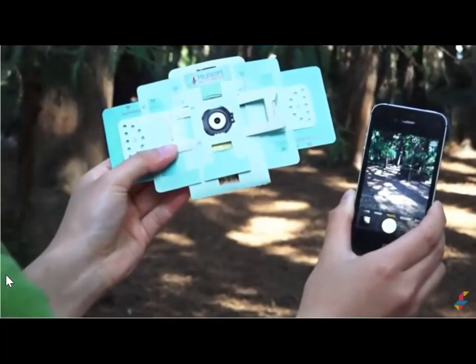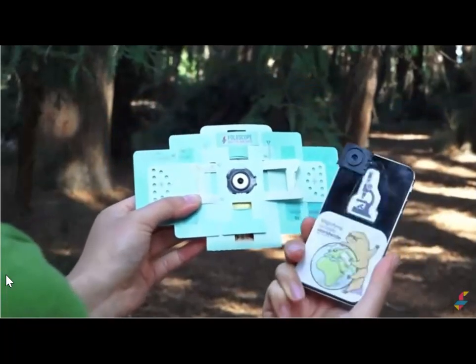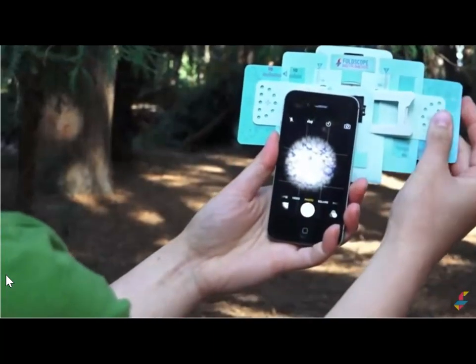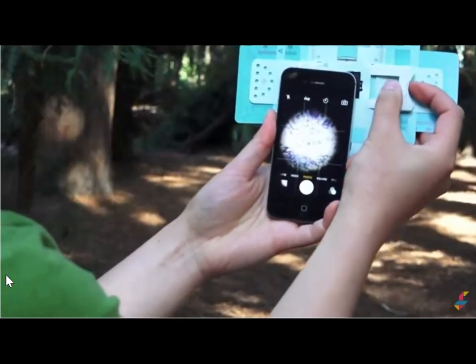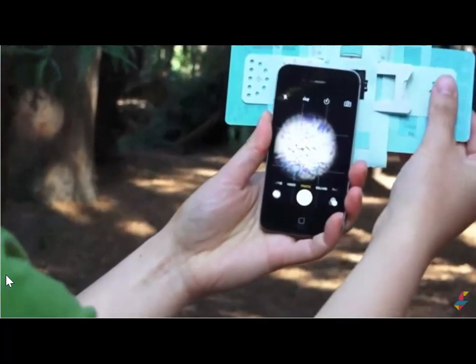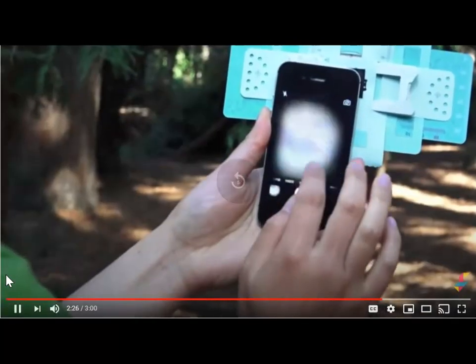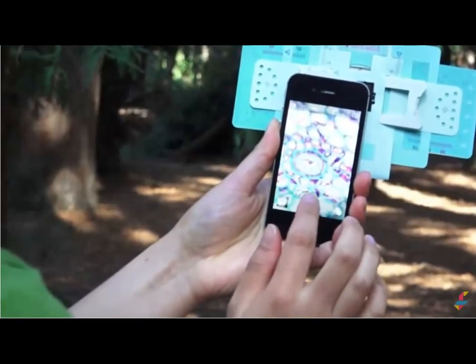Now let's mount your Foldscope onto your phone. After you've attached the magnet coupler onto your phone, all you have to do is attach the Foldscope like this. Then now you can move around easily and focus your image using the focus ramp. And take pictures whenever you see something very beautiful and interesting. So look. Use a digital zoom like this and take an even closer look.